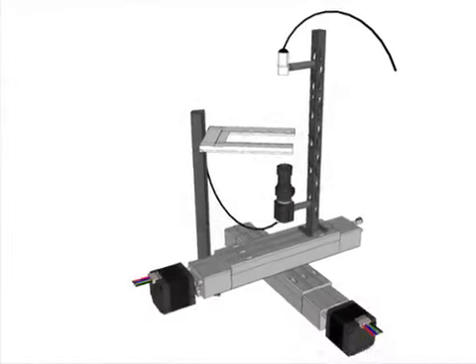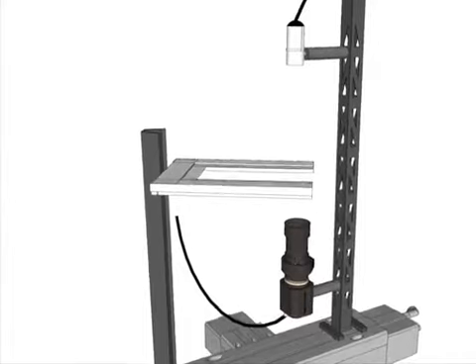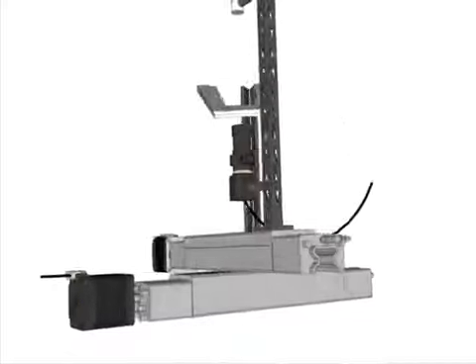changing their shape. To quantify these movements over long distances and at high spatial and temporal resolution, we have built a worm tracker to capture the motion of C. elegans as it crawls on the surface of an agar plate. We have also developed software to isolate and analyze these movements quantitatively using custom programs written in LabVIEW and MATLAB.